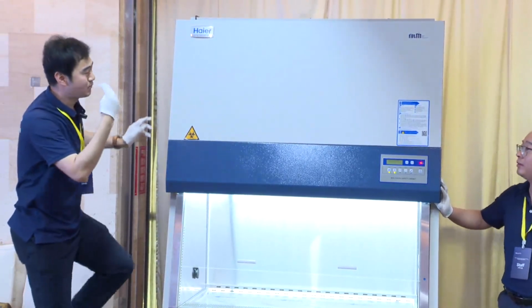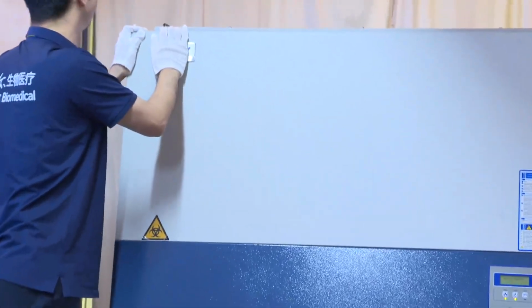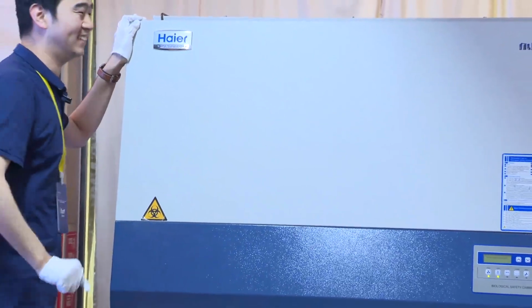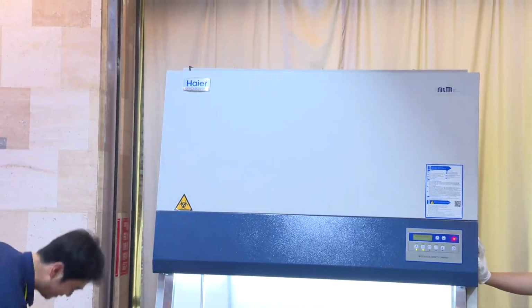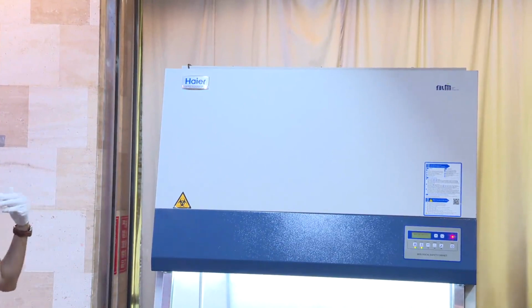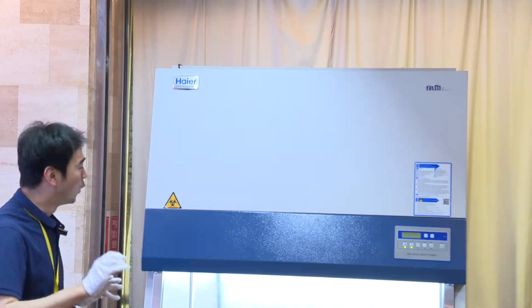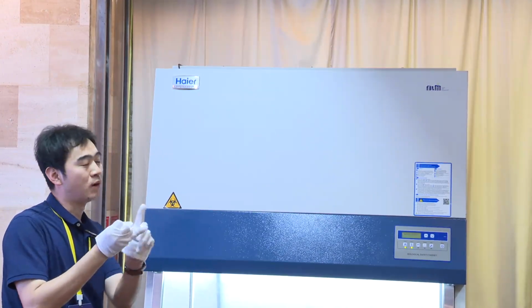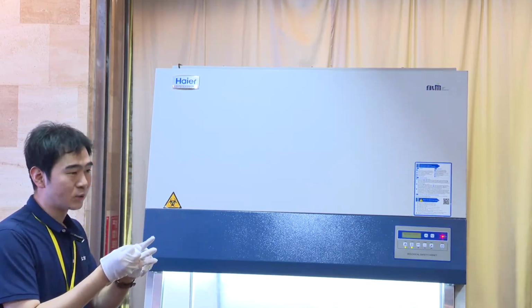Okay, I will check with my hand here. Maybe sometimes we need a bigger ladder. As I checked here, no cover. So this one is okay. So only 2 reasons are possible. One is the control board issue. Another is our pressure sensor issue.